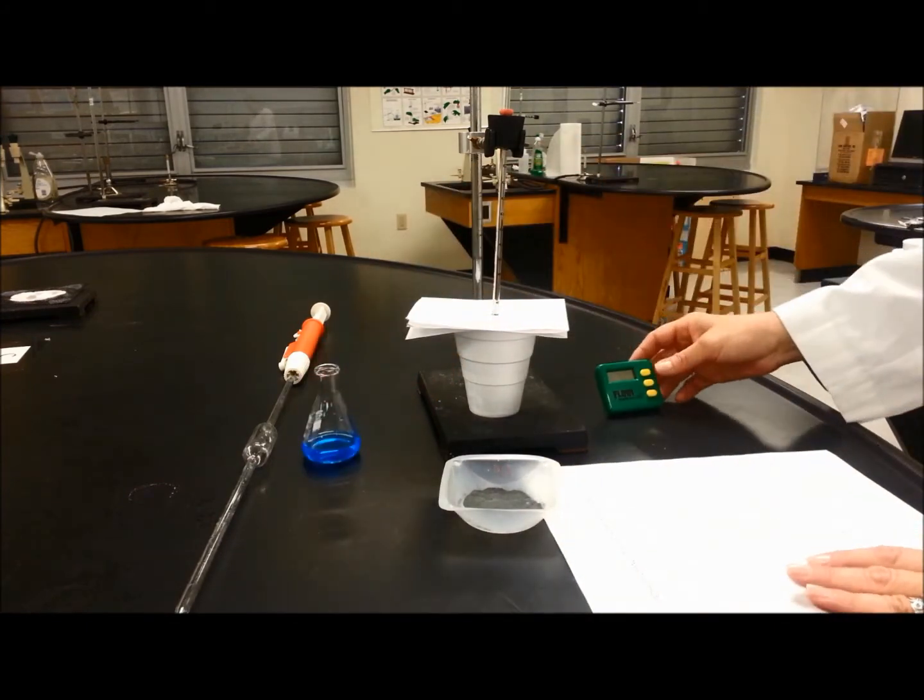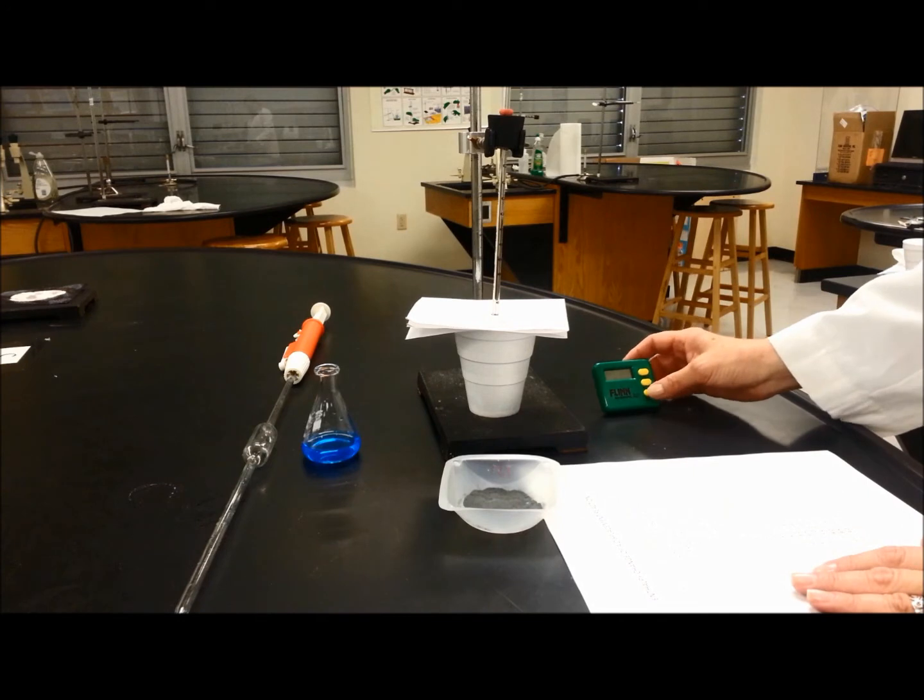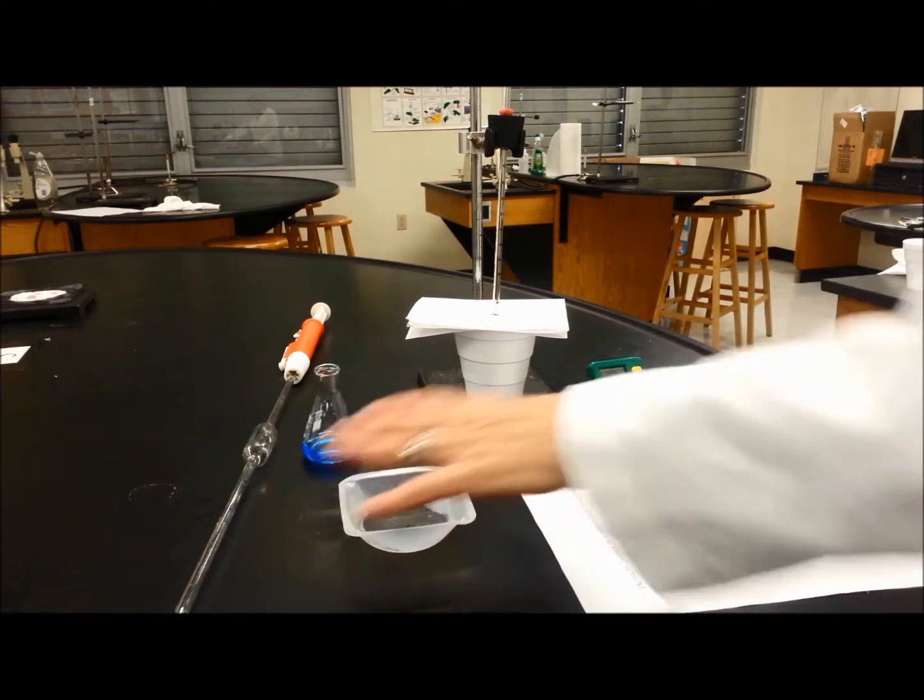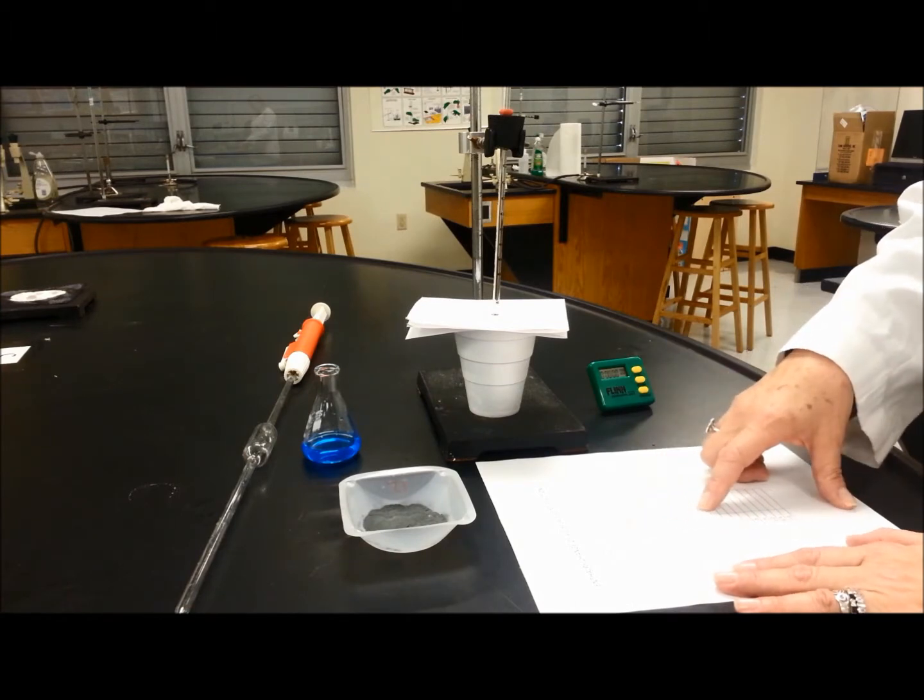So we are going to record the time. Every 30 seconds, we are going to record the temperature.